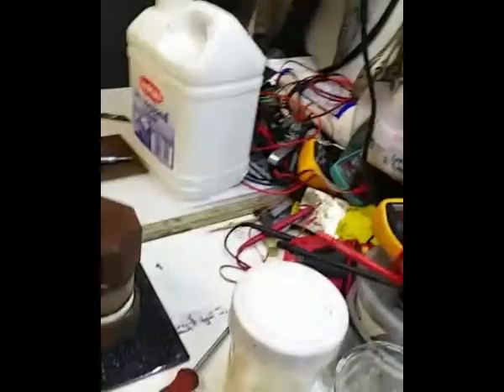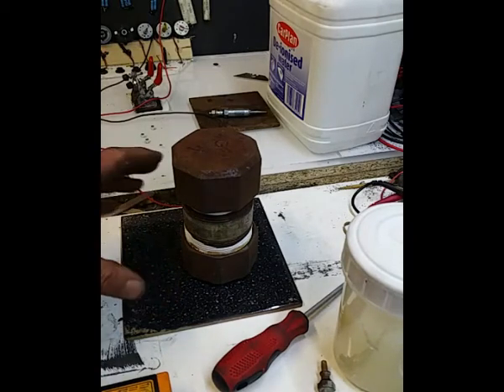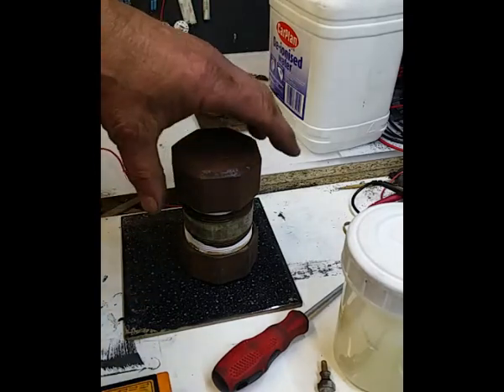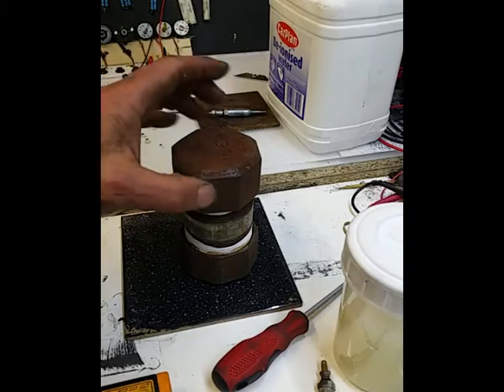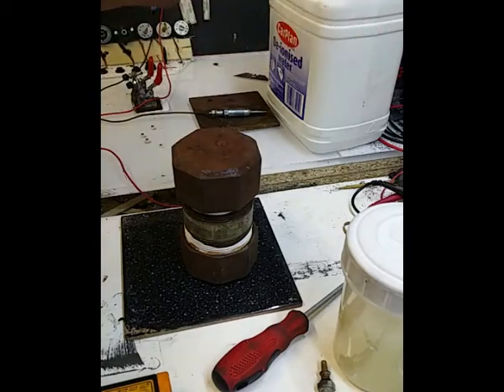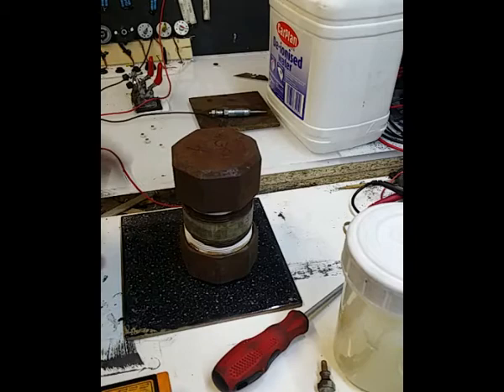Okay. So yeah, on the whole, I'm pleased with it. It works. But we need a jacket, I think, to stop thermal runaway. Now, I didn't think of this at first, but you're going to get thermal runaway continuously in air, with the temperature of the room and all the rest of it, because it's not in an oven. So I think a thermal jacket is the way forward. But basically, the idea works.